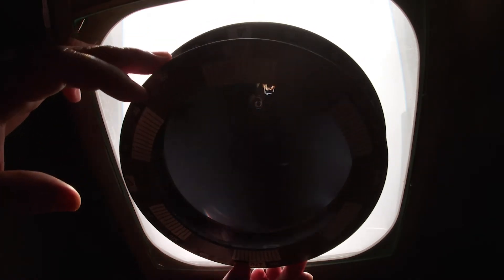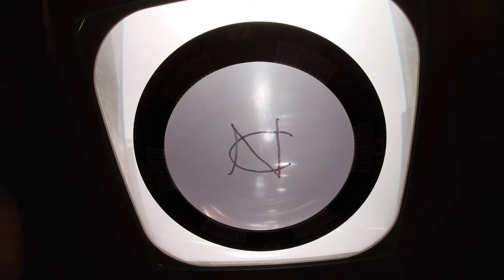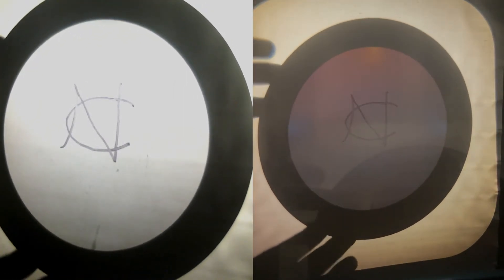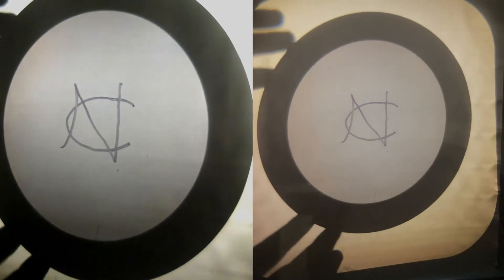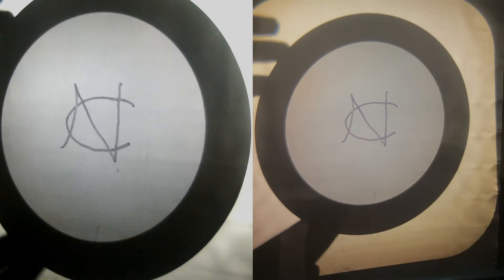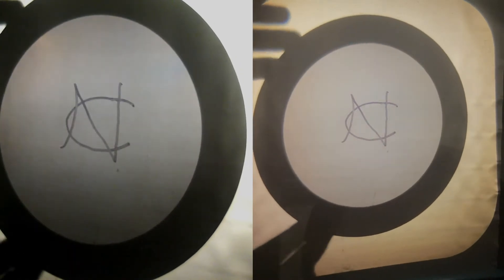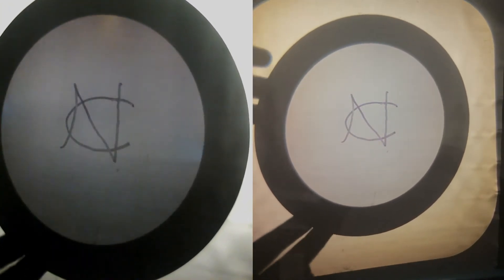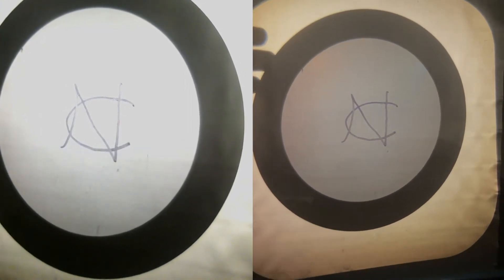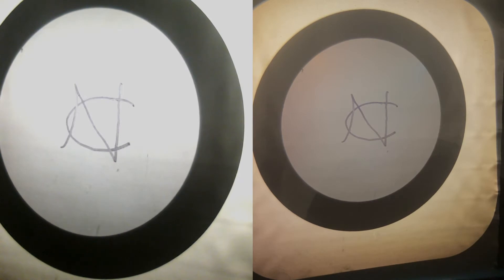We're actually only going to be working with one of these polarizers for most of the day, because we have two different polarizers mounted on our two camera angles visualizing this screen. As I move my polarizer, one screen gets bright while the other gets dark — acting as if you, the viewer, are holding one of those polarizers in front of your eye. I can show this to a large group because the polarization is preserved as it bounces off the screen.